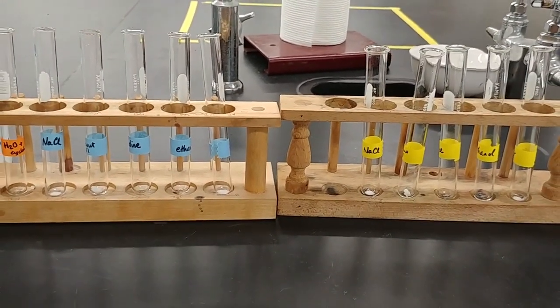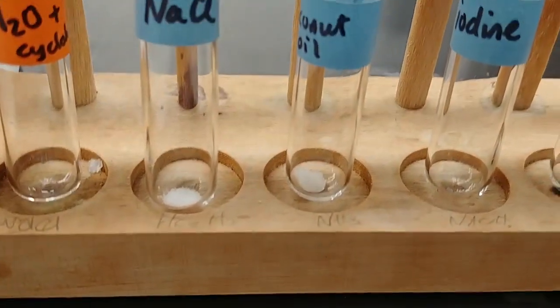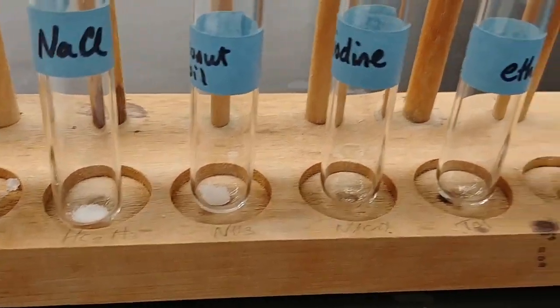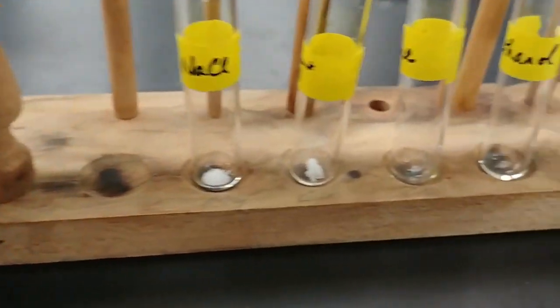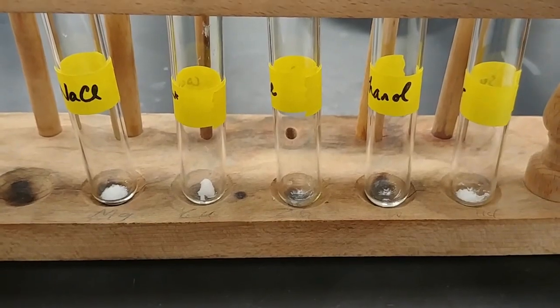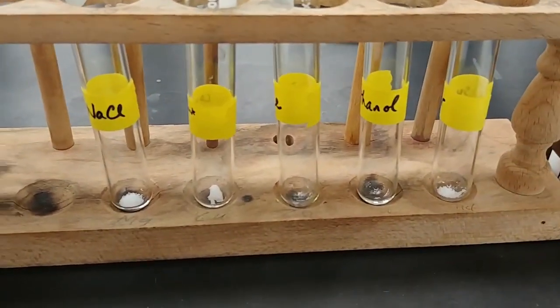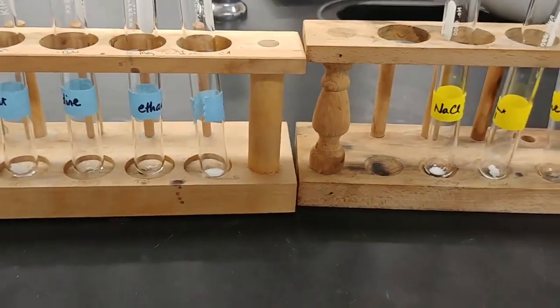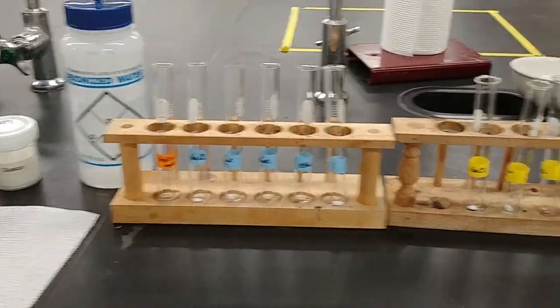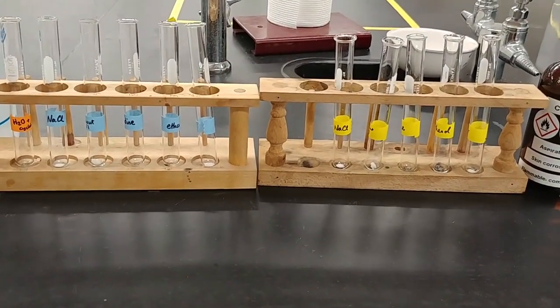I've already set up a couple of test tubes with small amounts of the solid in each one. A couple of them I still need to add a little bit of solid. Notice that I'm using very small amounts. This is because every solid is going to run into something called a saturation point. If we oversaturate our solution, not all of it is going to dissolve. Once I get the rest of the solids in here, we will be looking at adding the two solvents and comparing which one does a better job of dissolving our solutes.